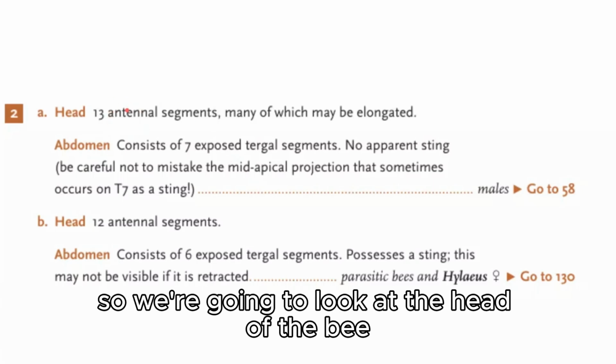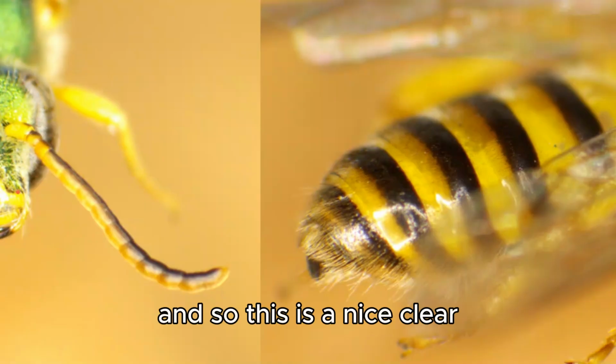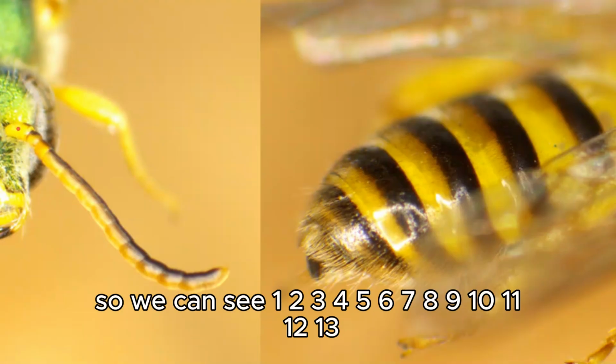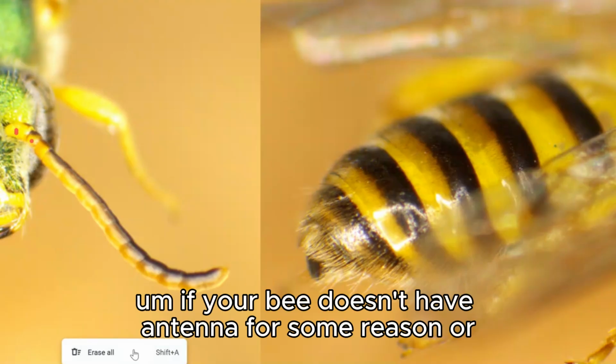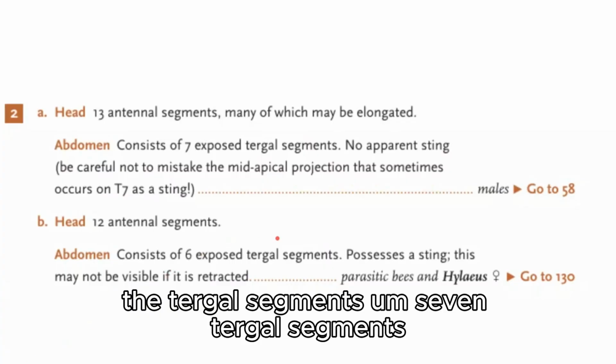We're going to look at the head of the bee. This is the easier way to determine the sex. This is a nice clear shot here, and we can just start counting. We can see 1, 2, 3, 4, 5, 6, 7, 8, 9, 10, 11, 12, 13. So this is going to have 13, which means that it is a male. If your bee doesn't have antennae for some reason, or it's very hard to tell, you can also count the tergal segments.